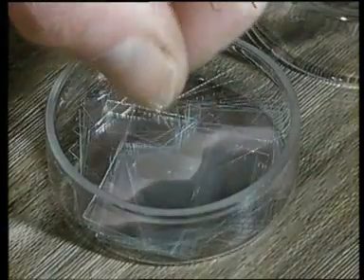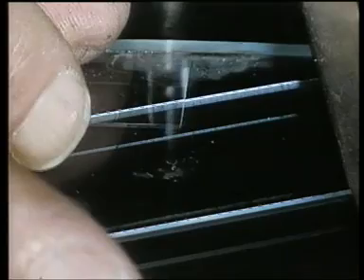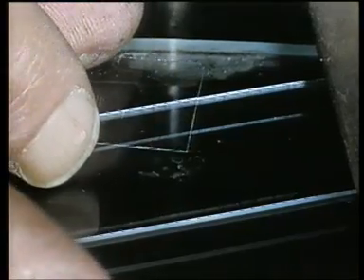A microscope coverslip is placed over the glands, dropping it just heavily enough to rupture without shattering them. The material is examined under a standard microscope with a good-quality, high-power objective. If sporozoites are present, they'll be seen as relatively inactive, thread-like organisms drifting slowly in the surrounding fluid.